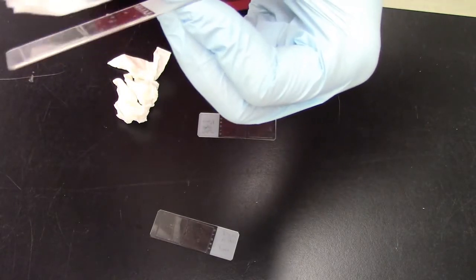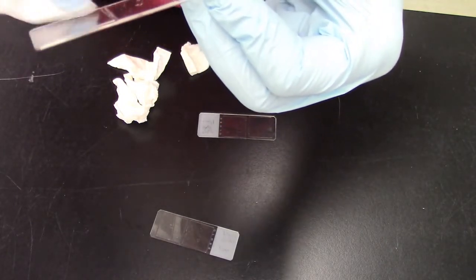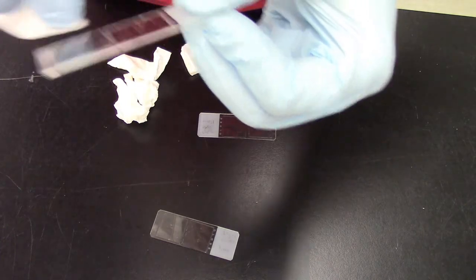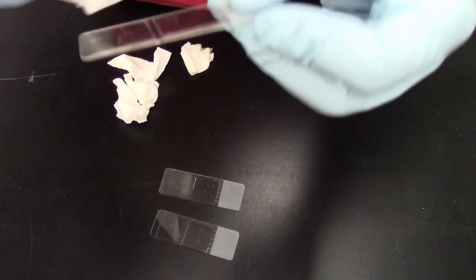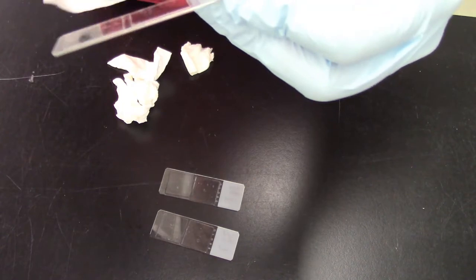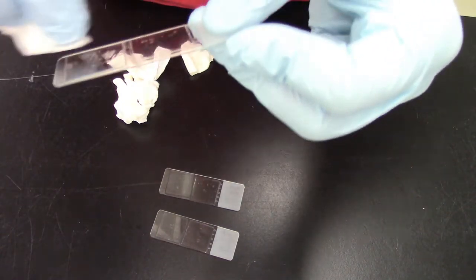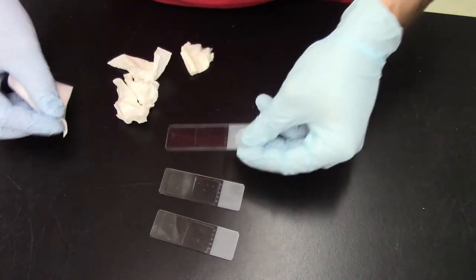Now also note that when after you image, you might be imaging with oils, oil immersion objectives. So there might be a drop of oil between the objective and your actual coverslip. And why is that important?